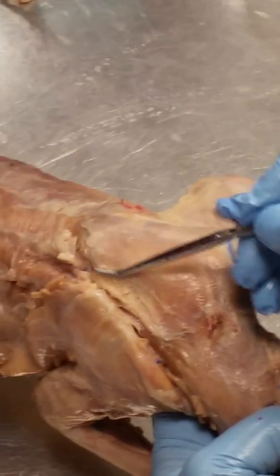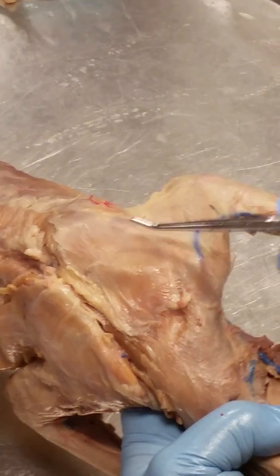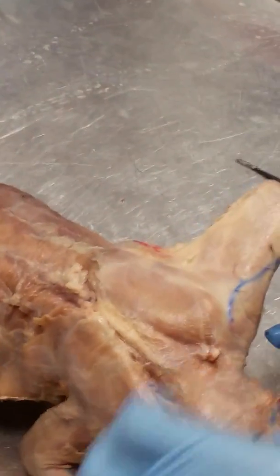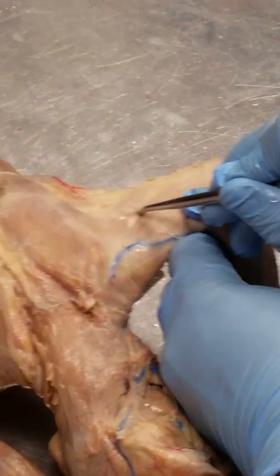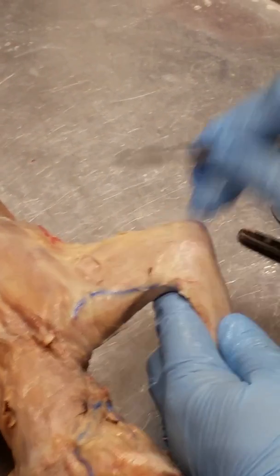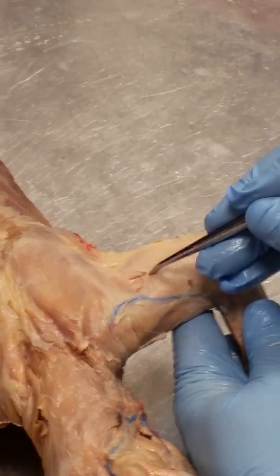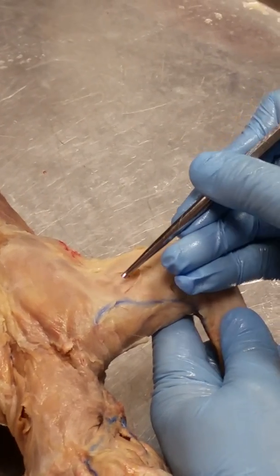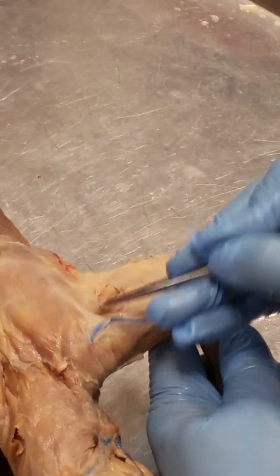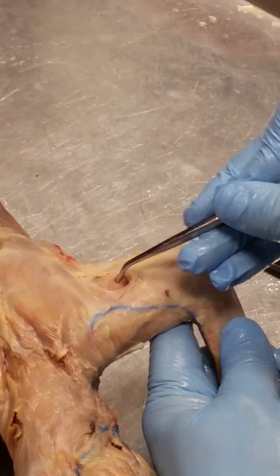Look at this big trapezoidal shaped muscle right here that's covering the shoulder blade. This is called the acromiotrapezius. Now to find the acromiodeltoid, you have to dig in this connective tissue in the arm. So your deltoid muscles are your shoulder and upper arm muscles. Your trapezius muscles are your shoulder and upper neck area muscles. Okay.